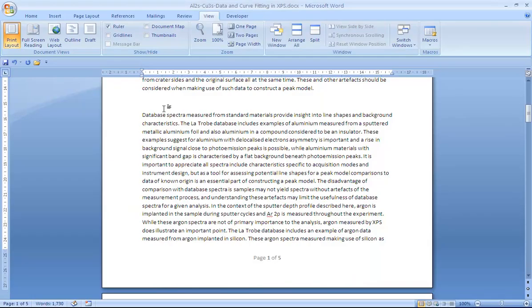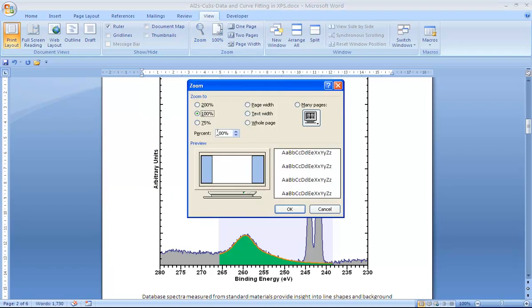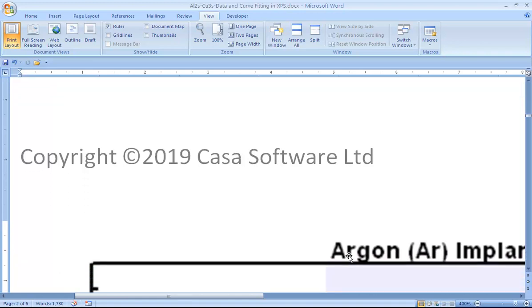And if we now paste the same image into Word, it looks reasonable within Word. However, the real test of whether it's of publication quality is if you look at, say, a 400% zoom of the same image. And when we zoom this by 400%, you can see that the text is slightly blurred when displayed in Word at 400%. And this is indicating that it probably isn't of sufficient resolution to allow a quality image to appear in some publication, paper, or book.